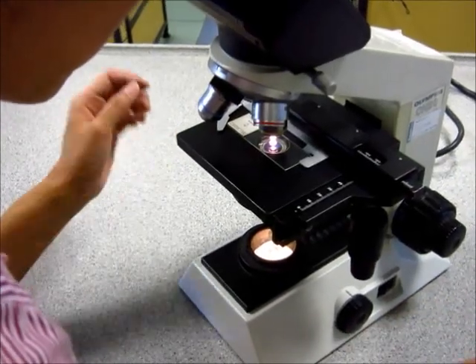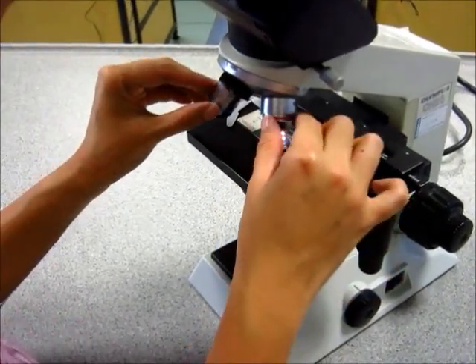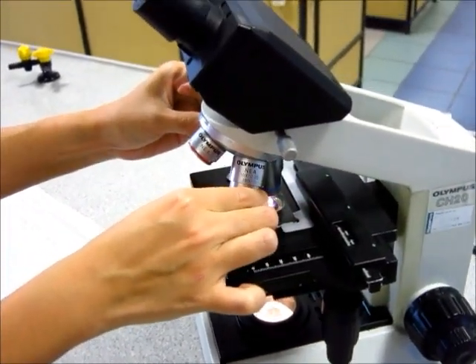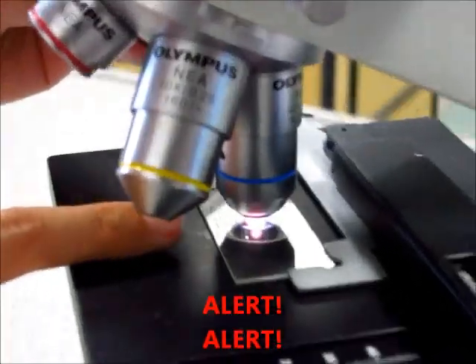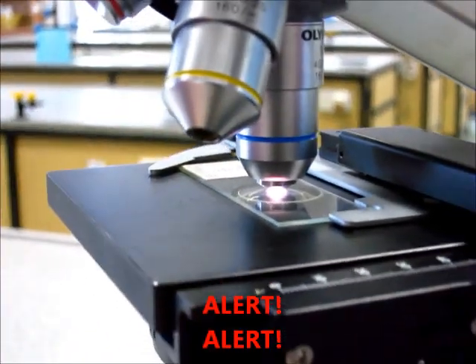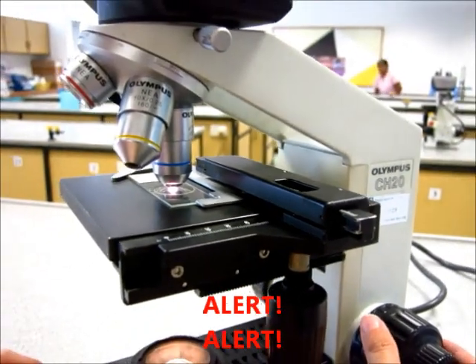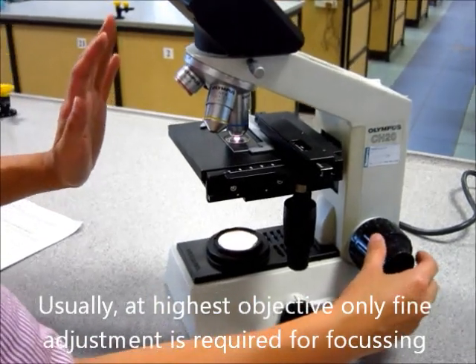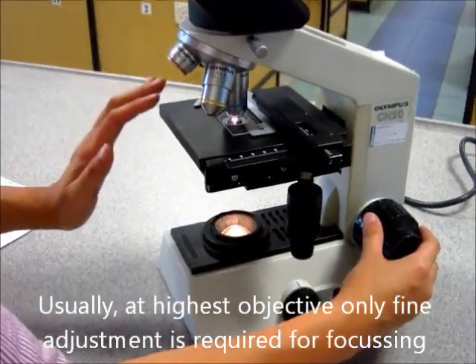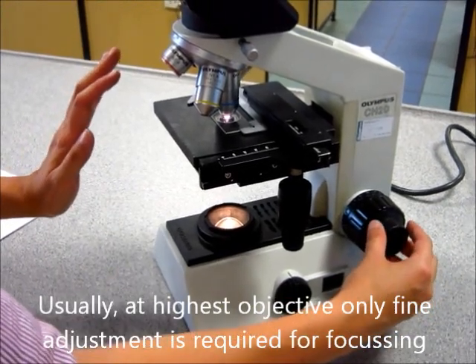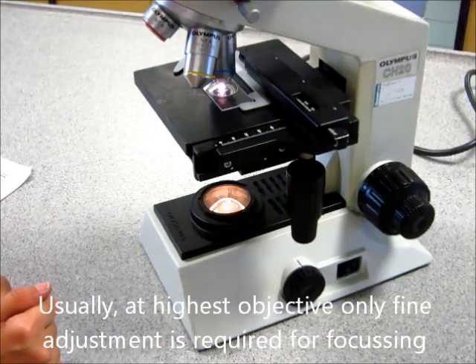And then now we are ready to go on to the highest objective. Now, be careful when you are turning to the highest objective because it has the longest lens. You can see that it's really near my slide at the moment. So because of this, every time you use the highest objective, never adjust using the coarse adjustment knob. Try not to. Usually, you don't need to adjust the coarse adjustment. Once you get to the highest magnification, you just need to adjust the fine adjustment and you will be perfectly fine. And then we should have a perfectly clear image.